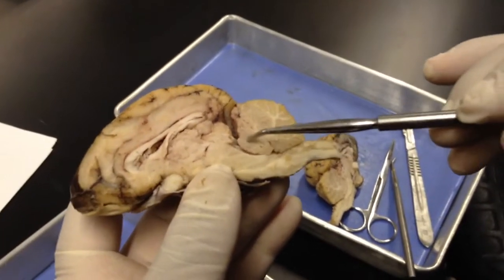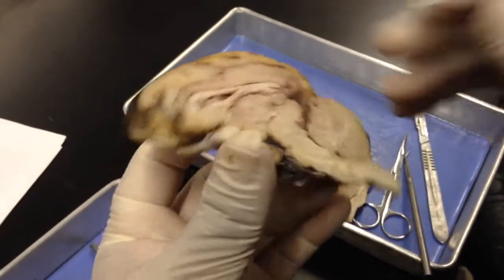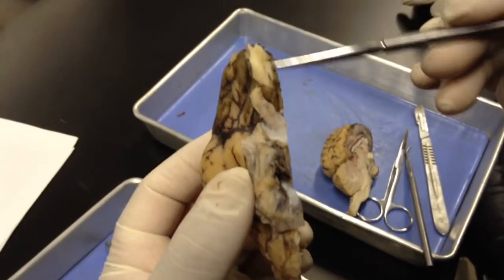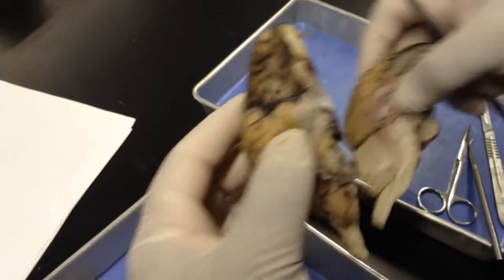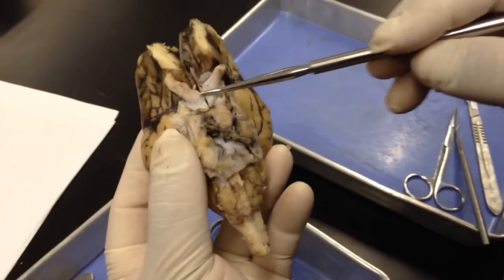Mid-sagittal, you can see the arbor vitae, which is all these white structures that you're seeing. And then as far as the cranial nerves that you guys are going to see in this brain, you have the olfactory bulb, which is essentially the olfactory nerve, which is number one. The optic nerve here. And keep in mind, when we put these together, you would have the optic chiasma, where they cross together.